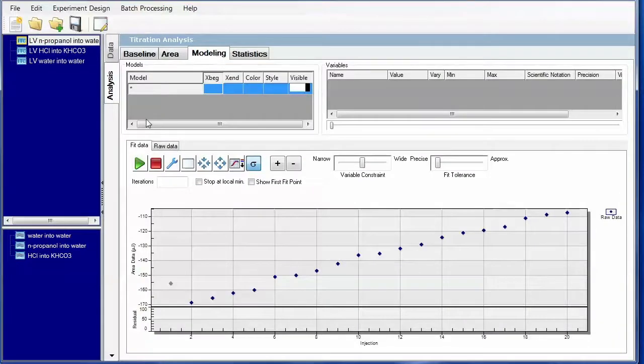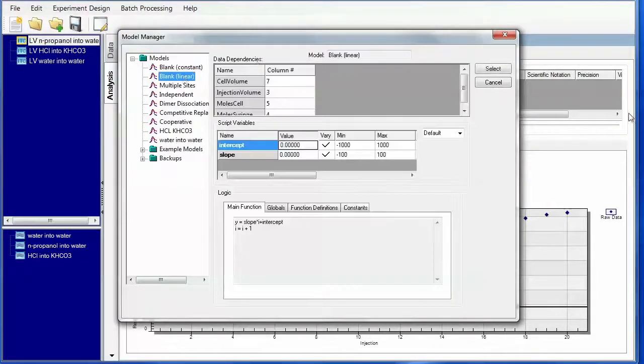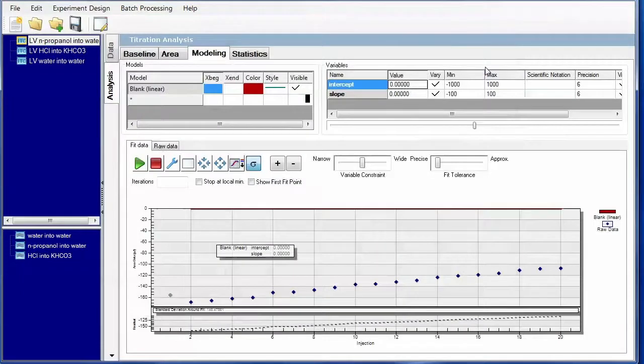For the N-propanol into water, as I've already done here, mask the first data point, and the appropriate model is going to be the blank linear model. Select that model, and again, let's apply some smart fitting. So we can create a large range here with a minimum, and we'll give ourselves a little bit of leeway.